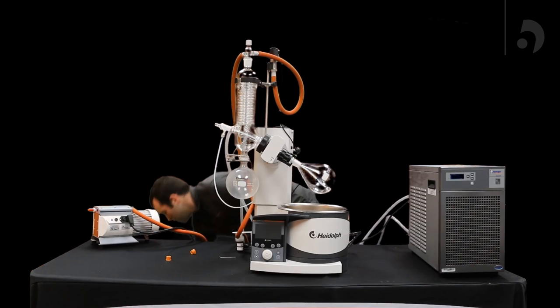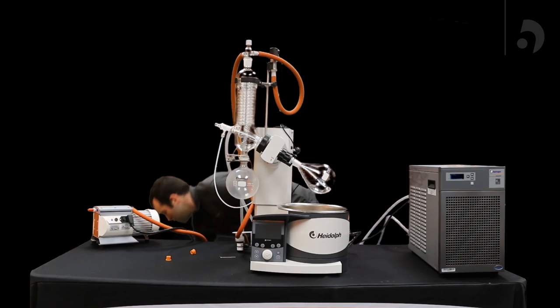And there you have it. That is how you assemble your chiller and your vacuum pump and connect it to your HiVap. Thank you very much.